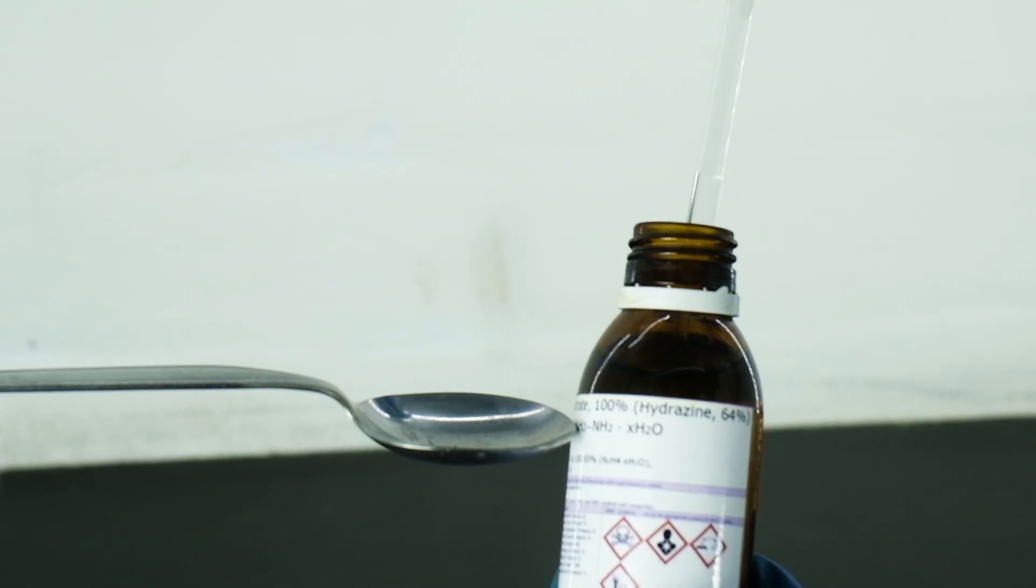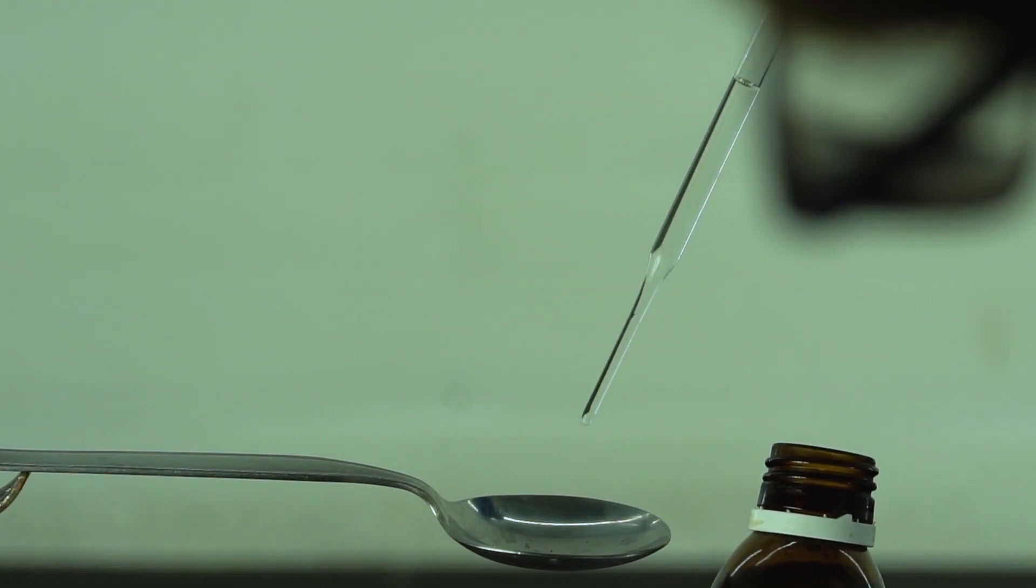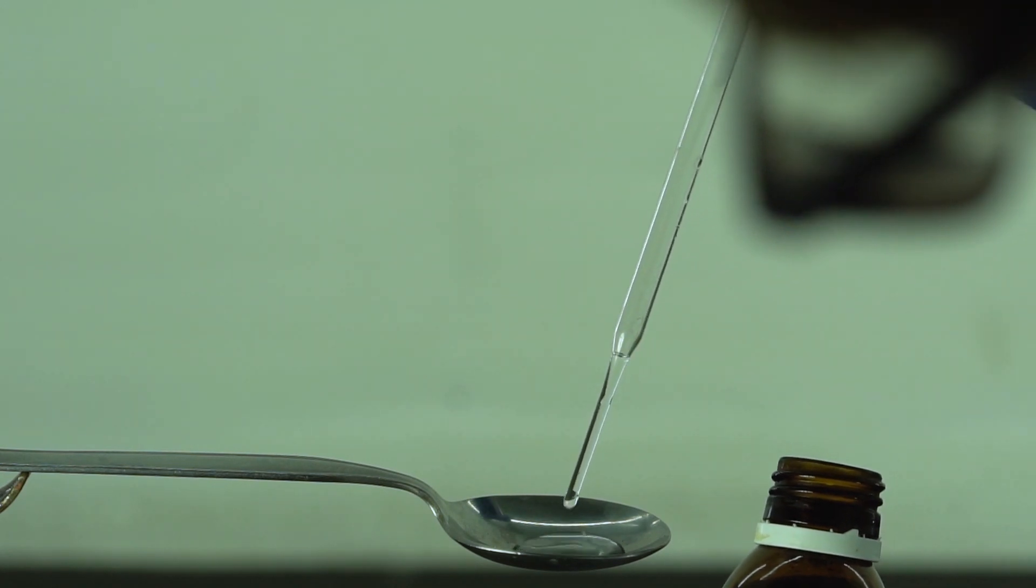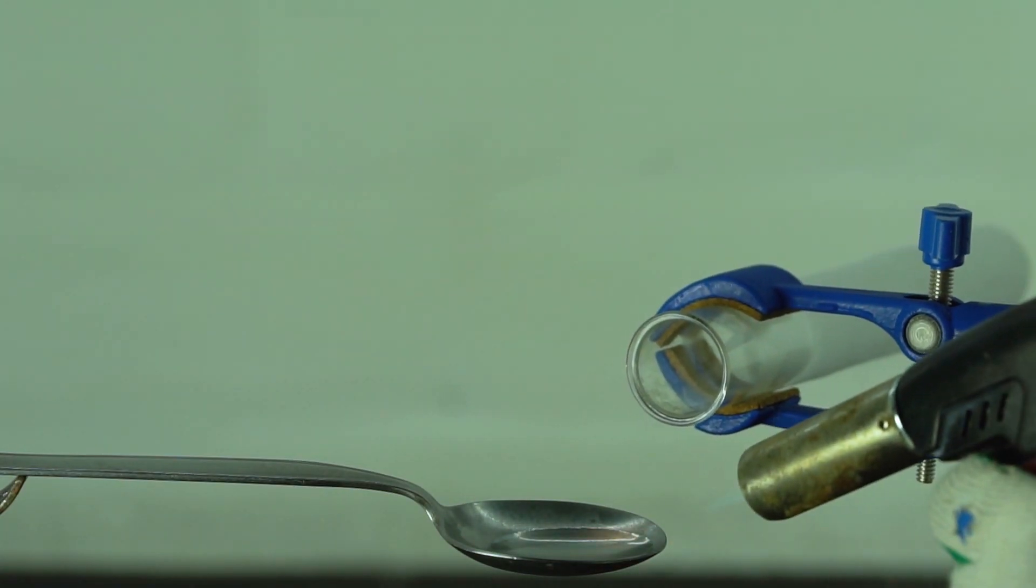On reaction with hydrazine, ignition occurs on contact, but for now I only have hydrazine hydrate at my disposal, so to perform the reaction with it we need to heat it up first.